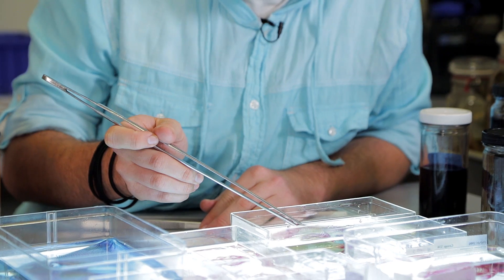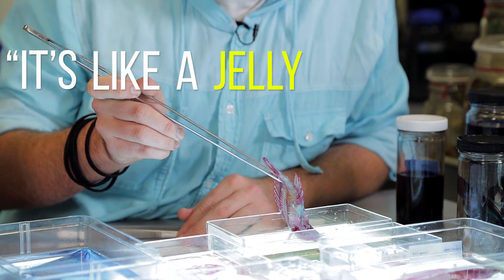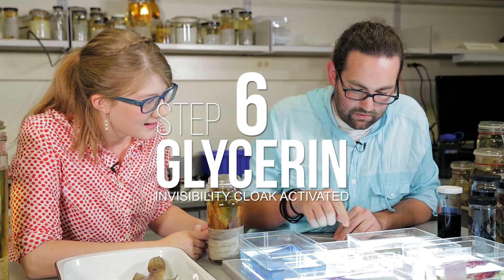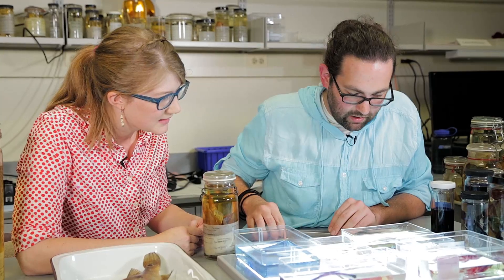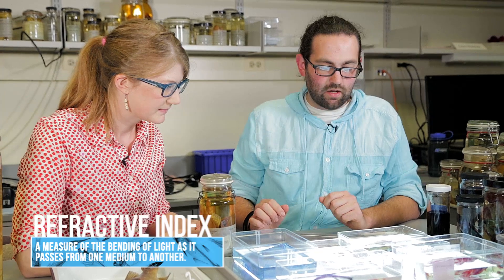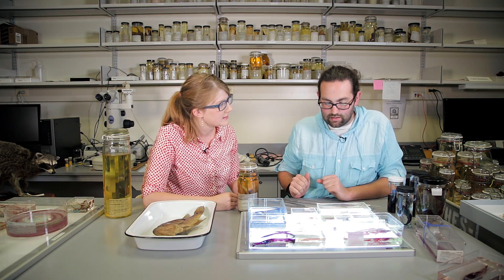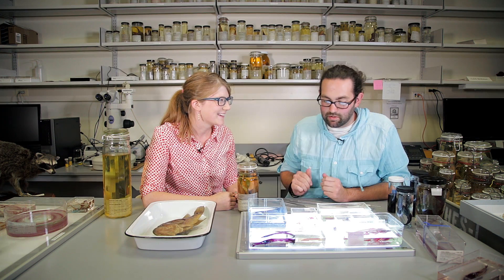You can see I can still pick this fish up — it's still an actual specimen. It's like a jelly specimen. There's not just a pile of bones in the tray. Then we store it in glycerin — this gooey kind of stuff here. What's really neat about glycerin is that glycerin and collagen have the same refractive index — the same way light passes through. So when you put this on a tray on a light box, you just get the skeleton to visualize it.